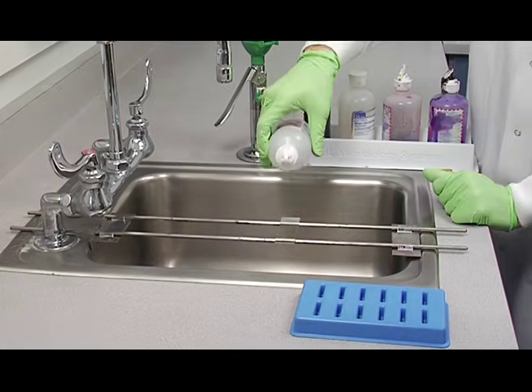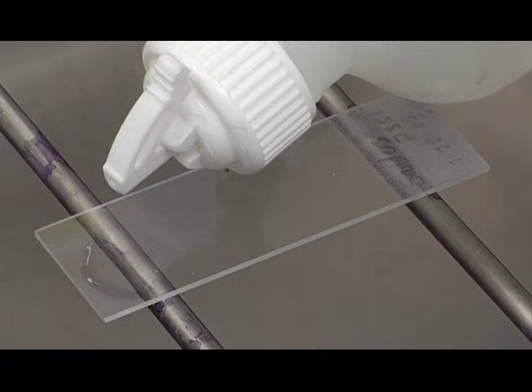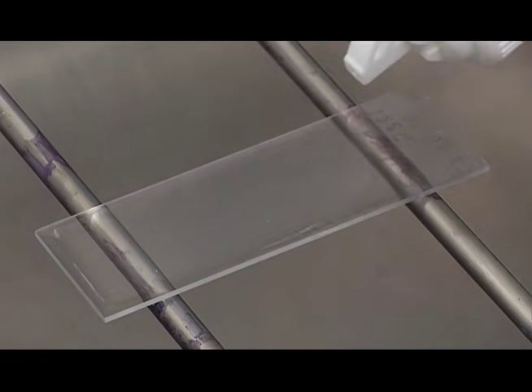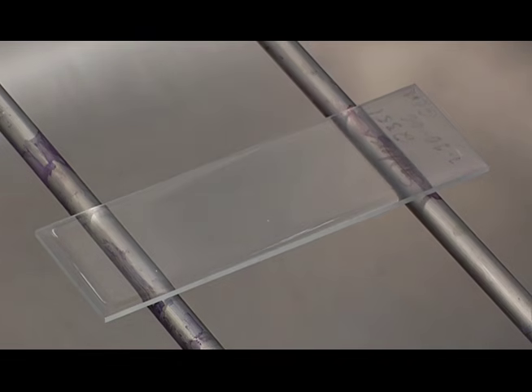Then flood the slide with methanol. Let it sit on there for 10 seconds.